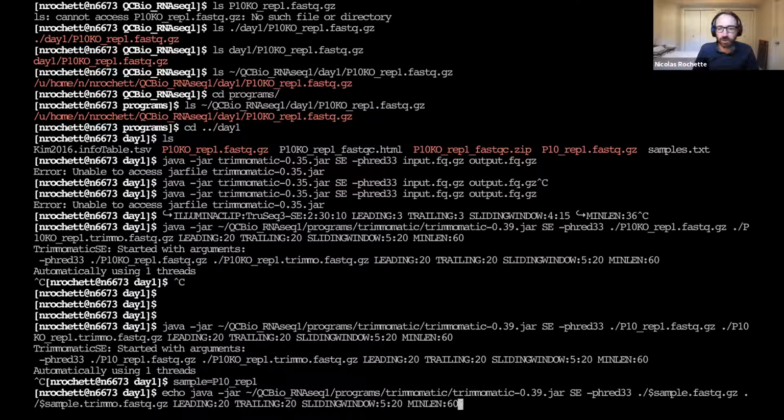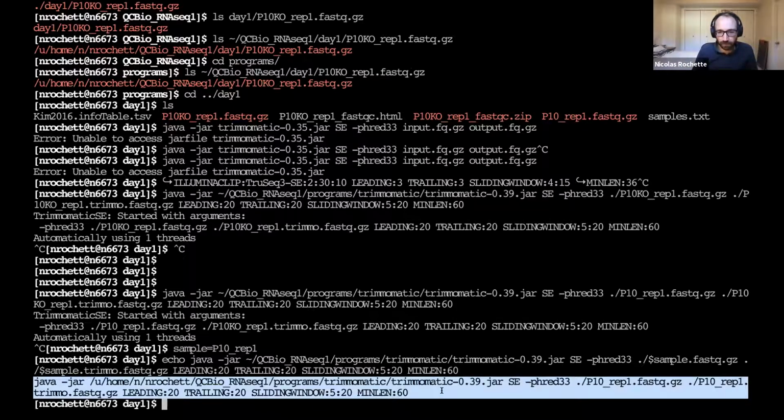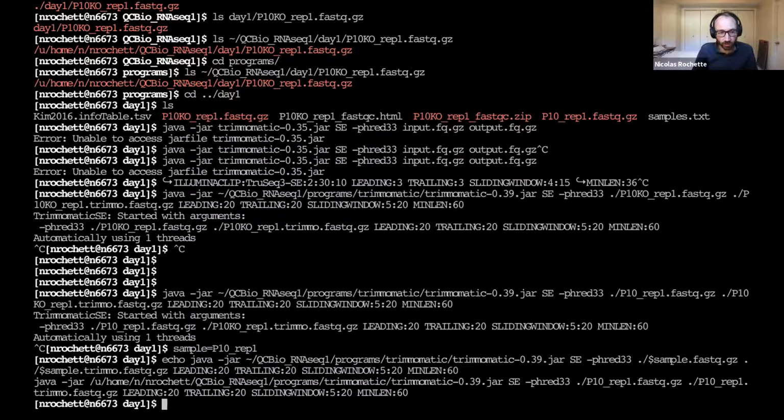And one way I sometimes use, and it's 4:30 soon, one way I sometimes use to check my commands like this, to check that everything is in order, especially when you start having variables, is just to add echo at the beginning, right? So it's not going to run the command, it's just going to echo the command itself. And so we get this. So this is what the command is actually going to look like for the shell, for the cluster. And here my variable has been replaced.